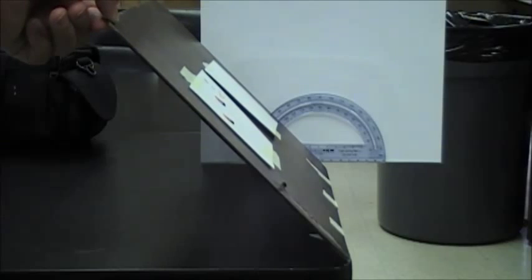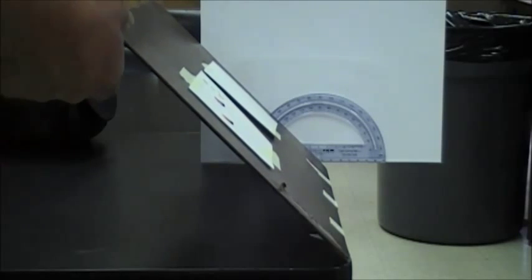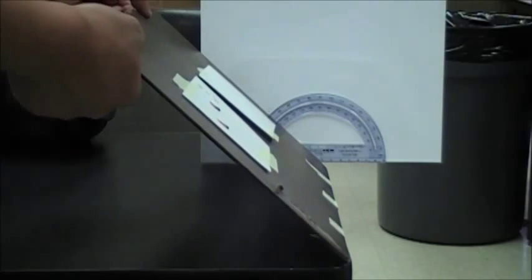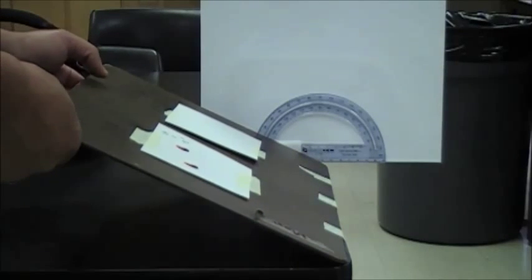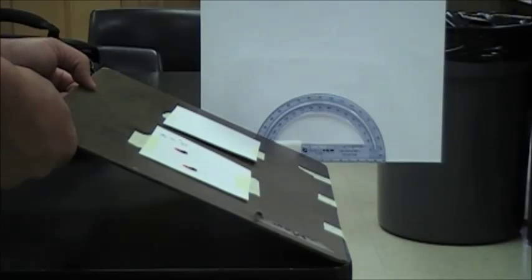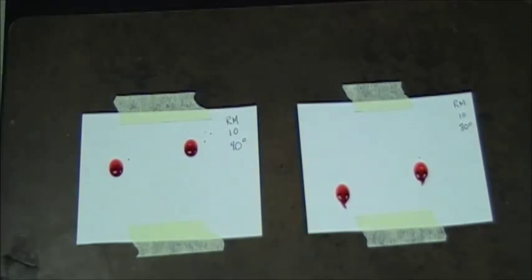While the first set of blood drops are drying, reset your whiteboard to your next calculated angle, and then perform the steps for dropping blood at that particular angle. Remove your index cards from the whiteboard and allow the next group member to perform the lab.